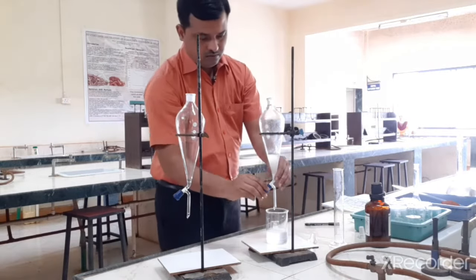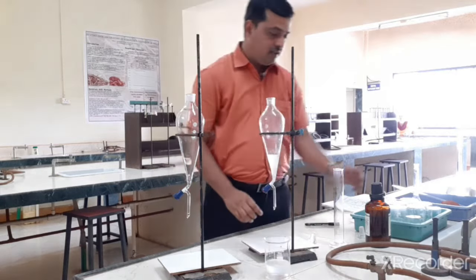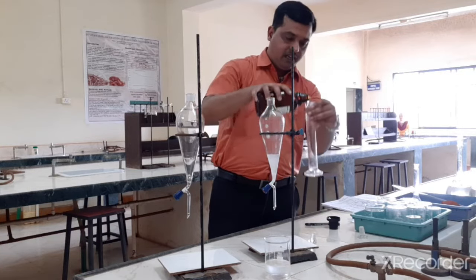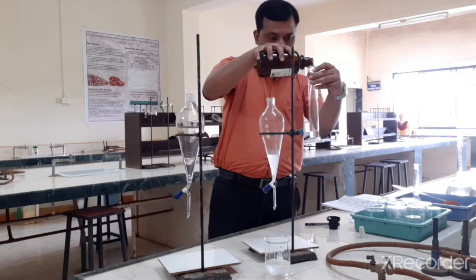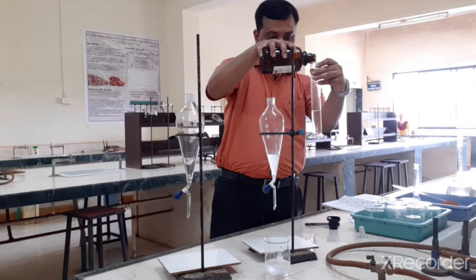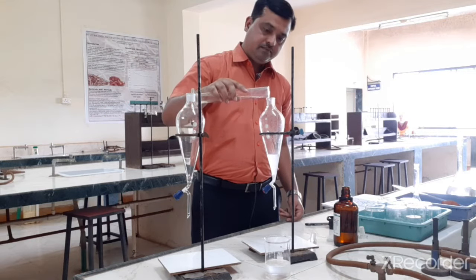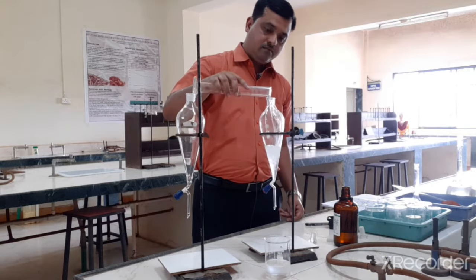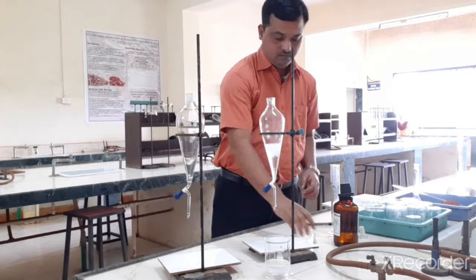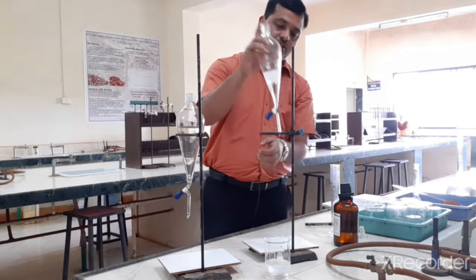Okay, so two portions of chloroform as an extractant phase we have extracted with fresh chloroform using the same raffinate phase or the aqueous phase. Now this is a third batch. Again I am taking 50 ml of chloroform and I will add it again. Okay, so I will again repeat the extraction.